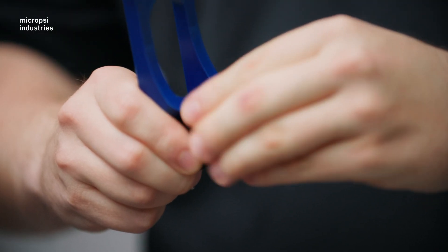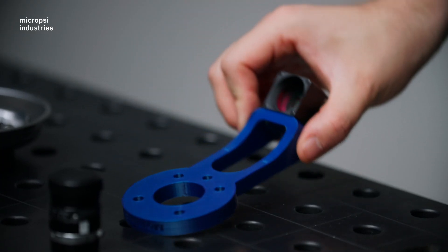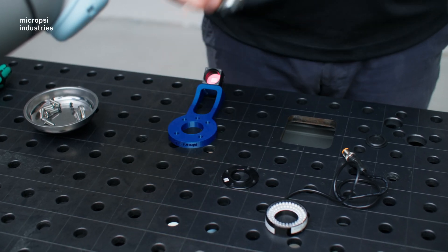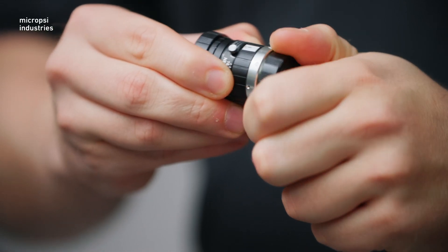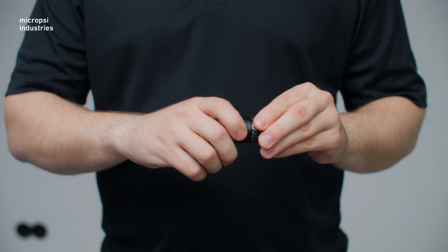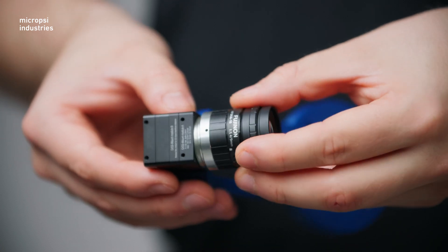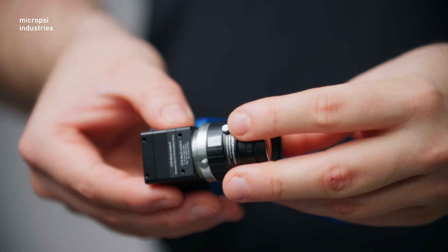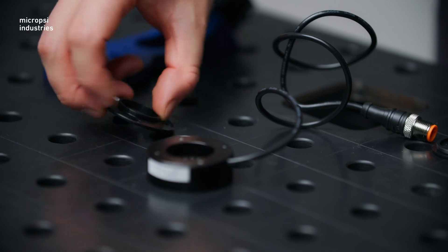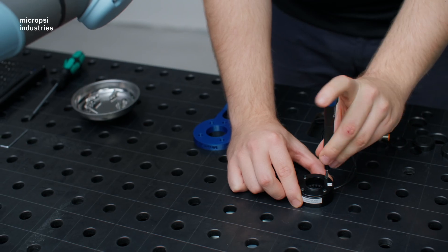With our camera here, if you put the assembly on a table, the camera should face up and the port is on the lower side. Now let's attach the camera lens — just carefully screw it into place. Finally, let's screw the ring light adapter to the ring light and attach that to the lens.